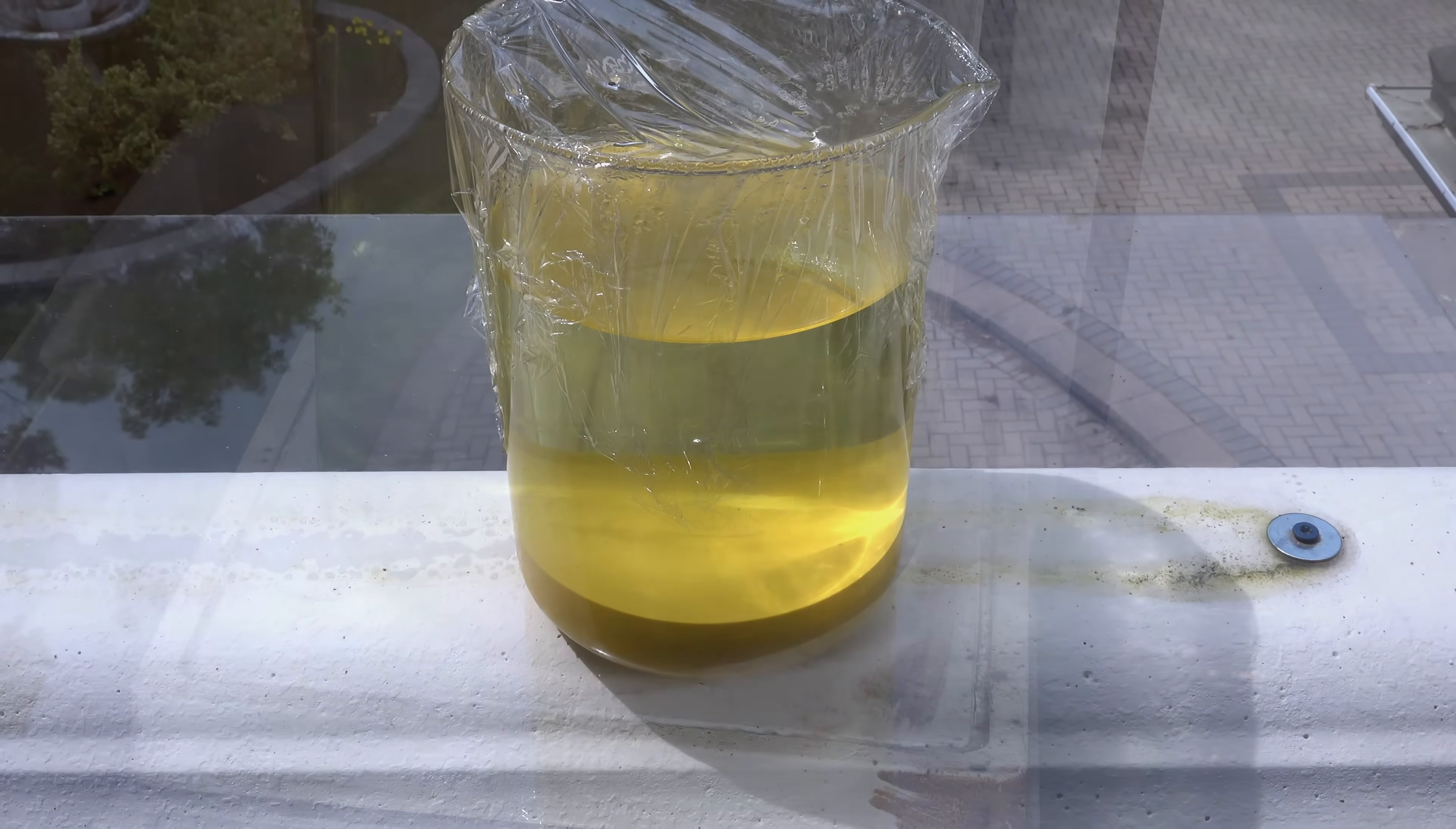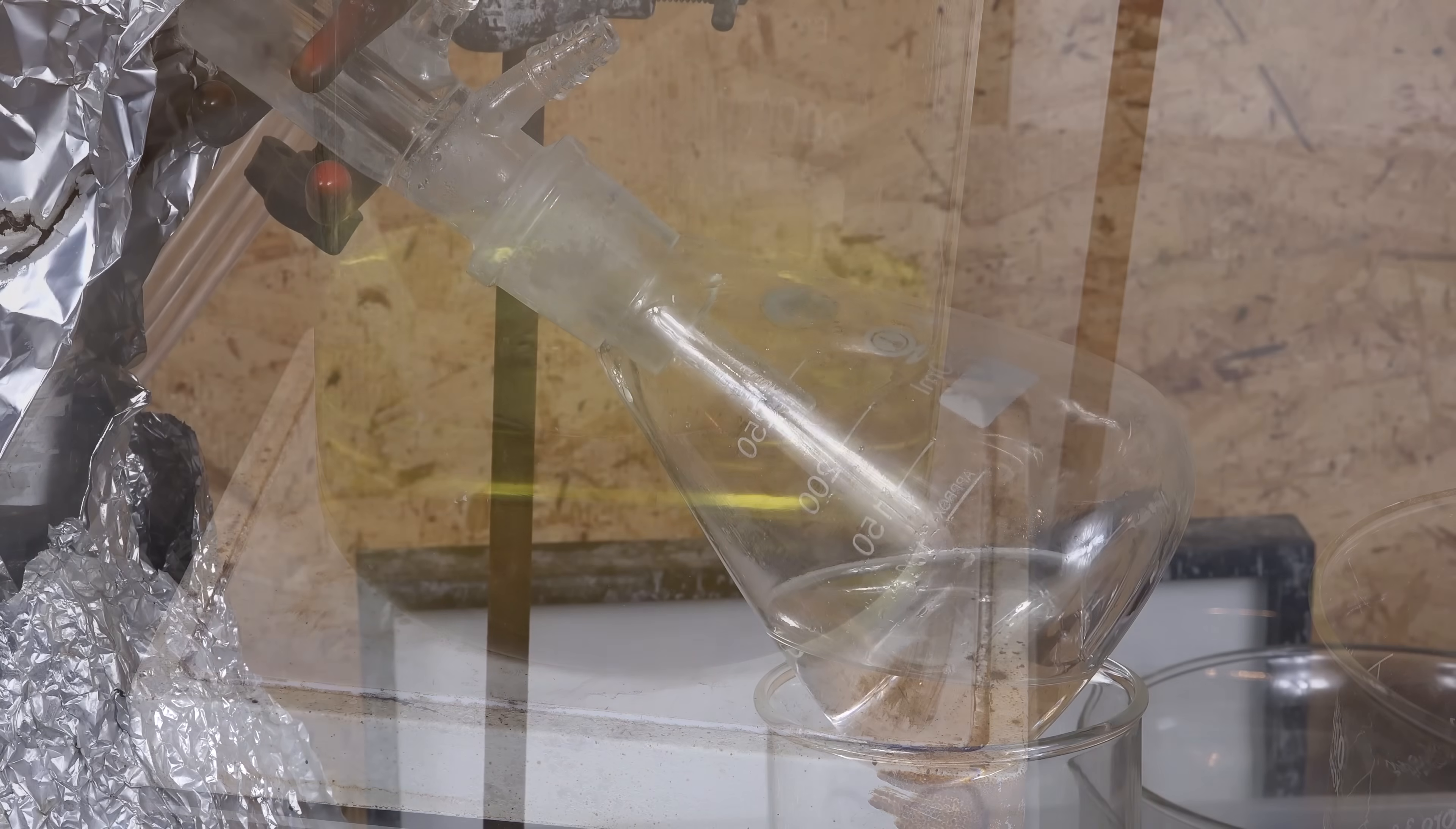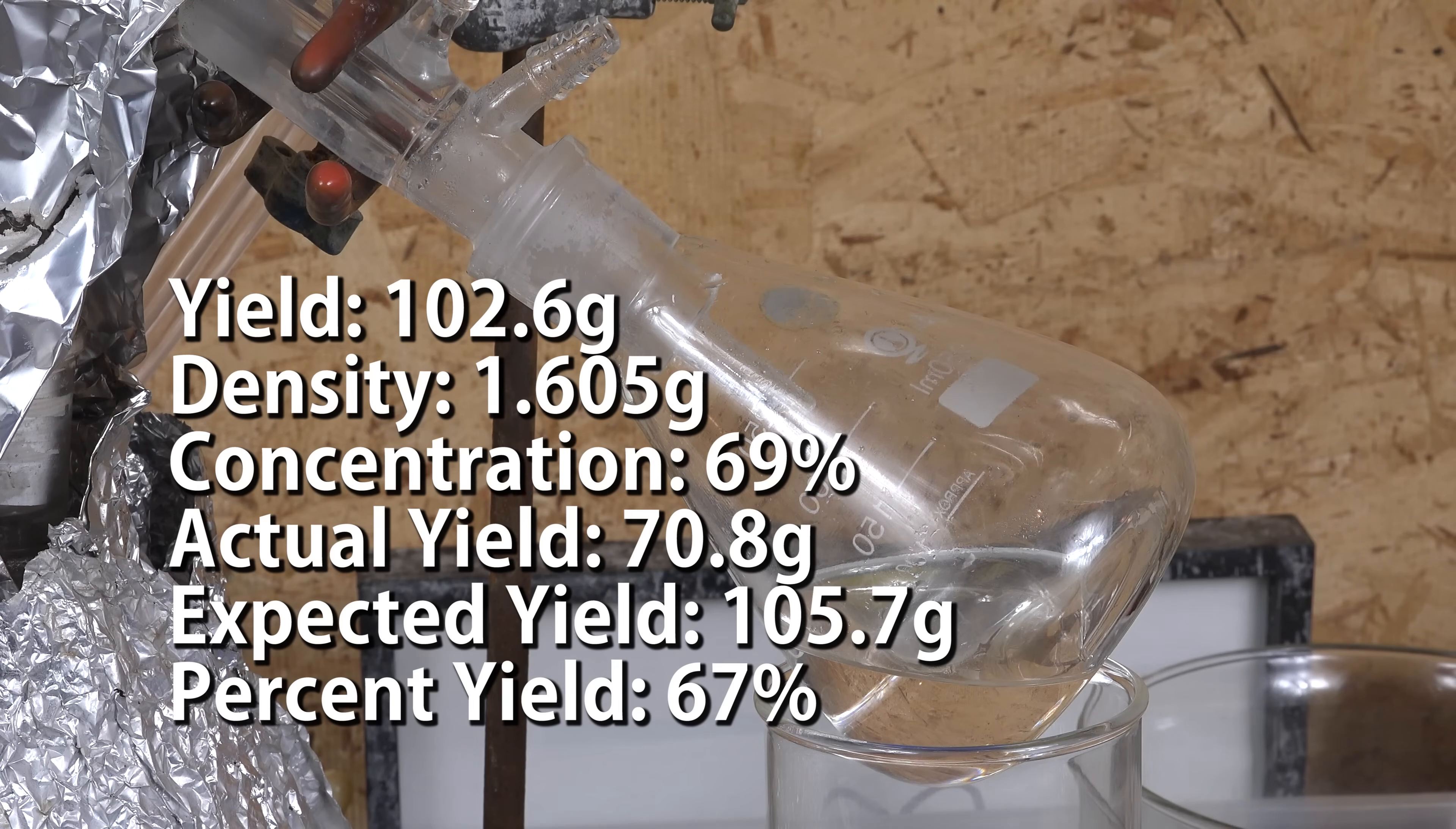Anyway, after 8 hours in the sun, I brought it inside, filtered it and boiled it down, distilled it and was able to obtain 67% yield.